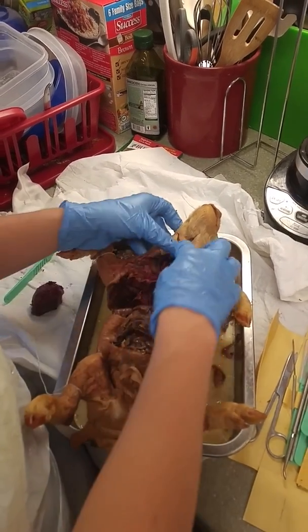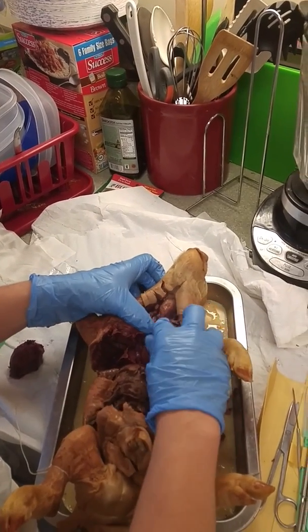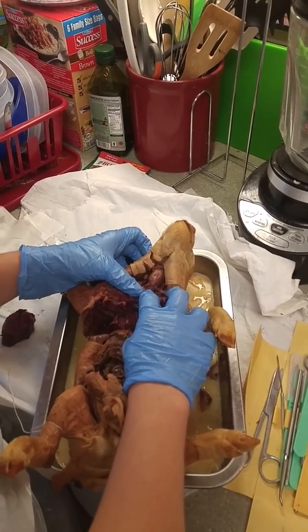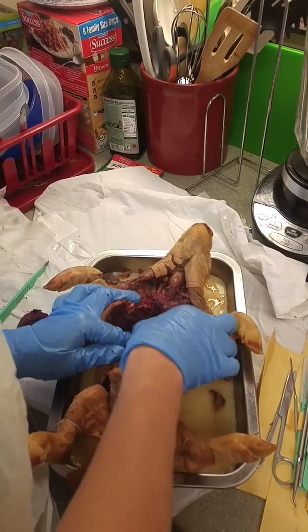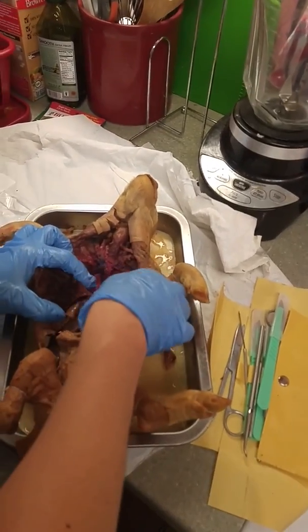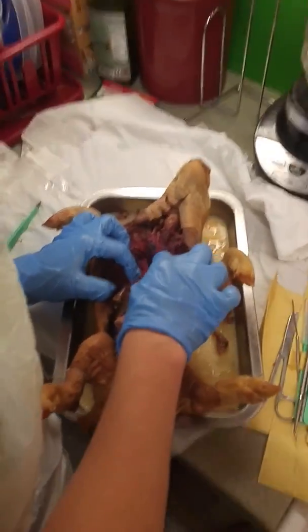In the neck region, the larynx is this large round shape right here, and then the trachea is just below that. You can tell because there's rings of cartilage running along the trachea. And the hilus of the lungs is where it bends in right here.